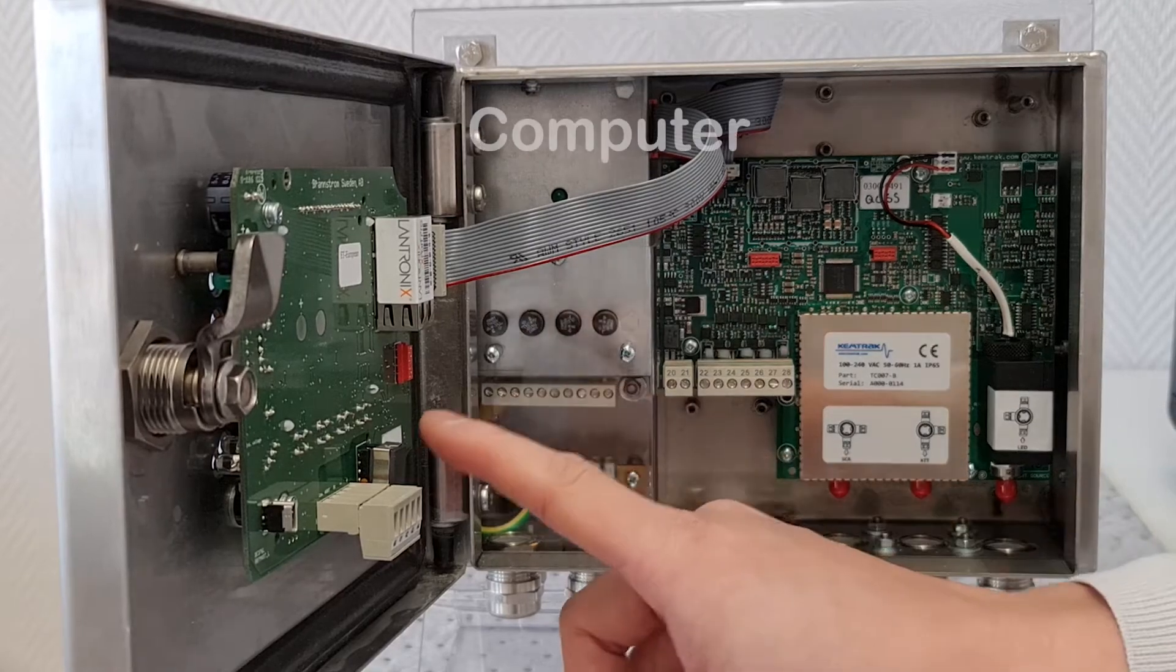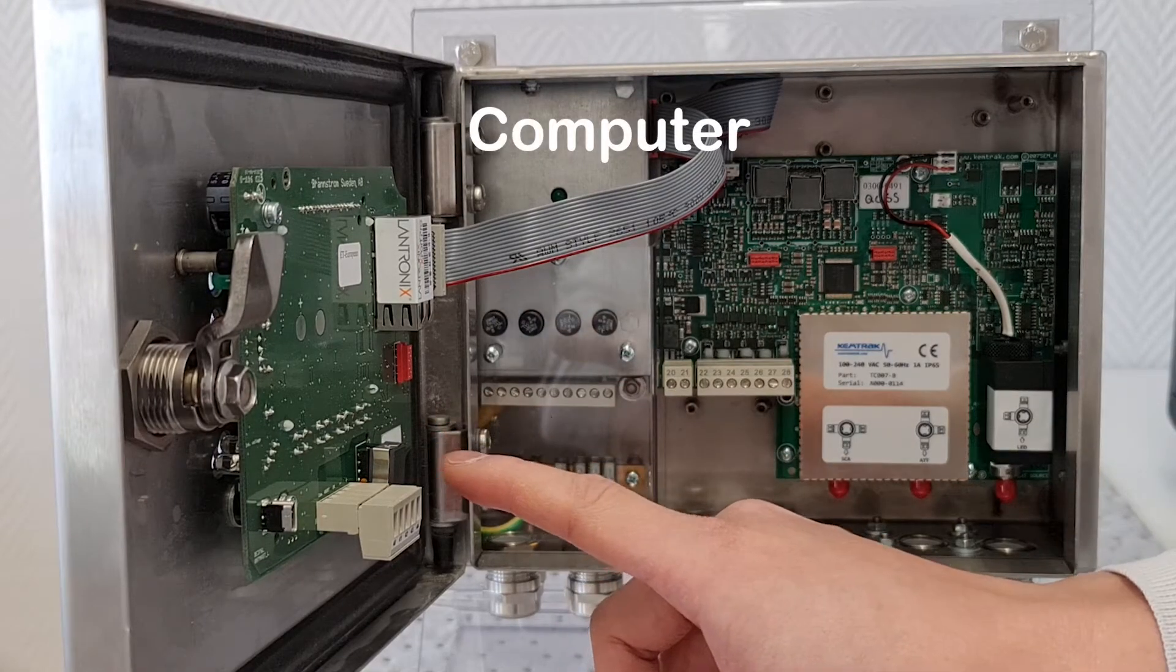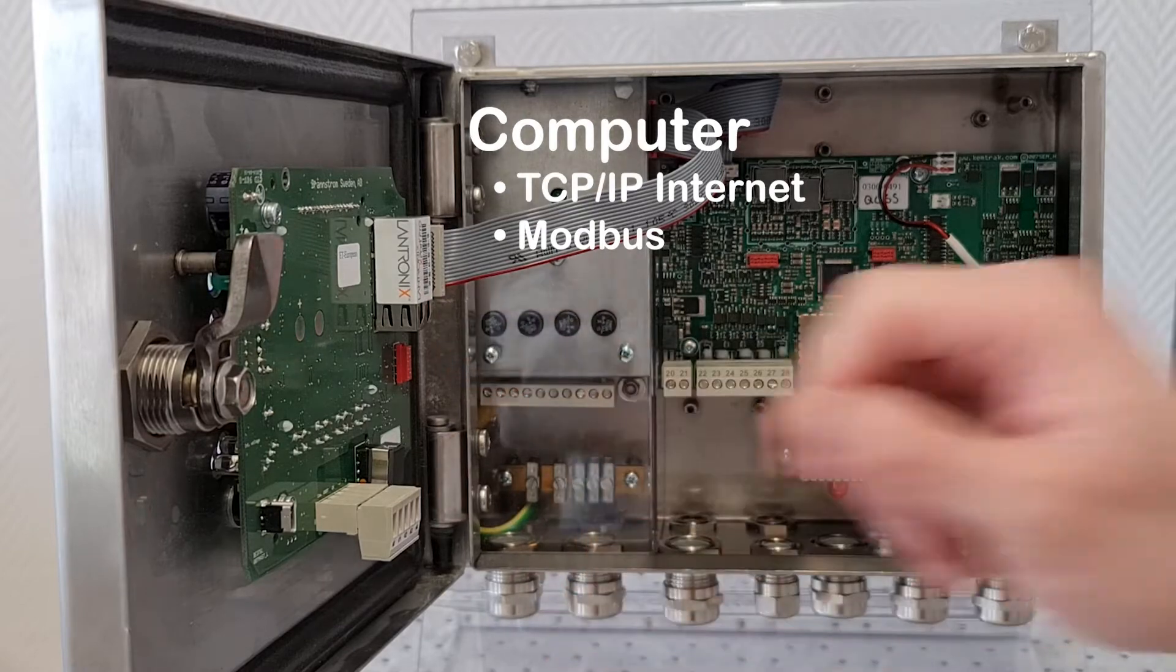The computer is mounted on the front door of the analyzer. The internet and modbus connector is also located here.